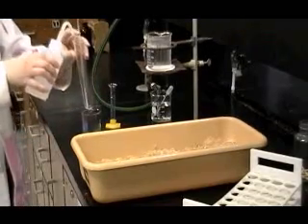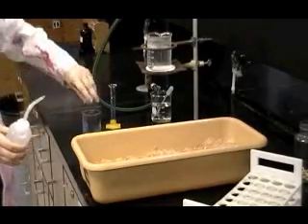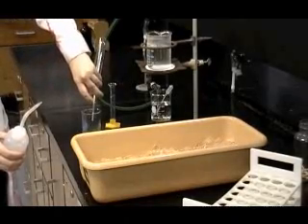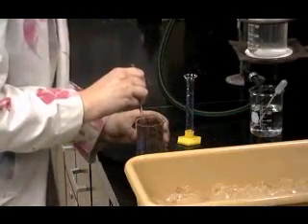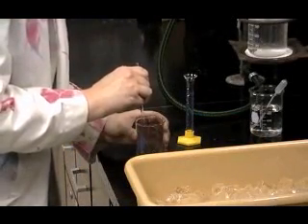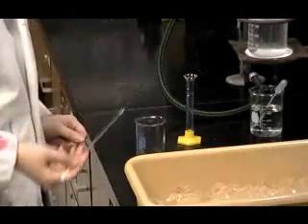If you do not have crystals at this point, scratch the inner wall and bottom of the beaker with a glass stirring rod to induce crystal formation. The vibrations produced when the glass scratches glass can induce the formation of crystals. If you still do not have crystals, contact your instructor.